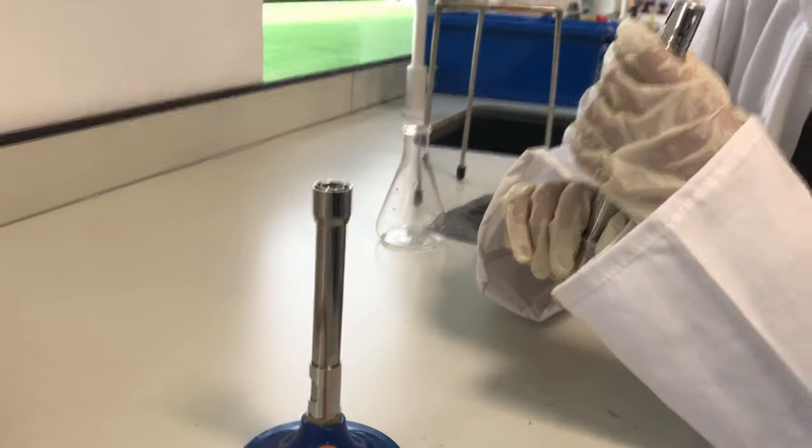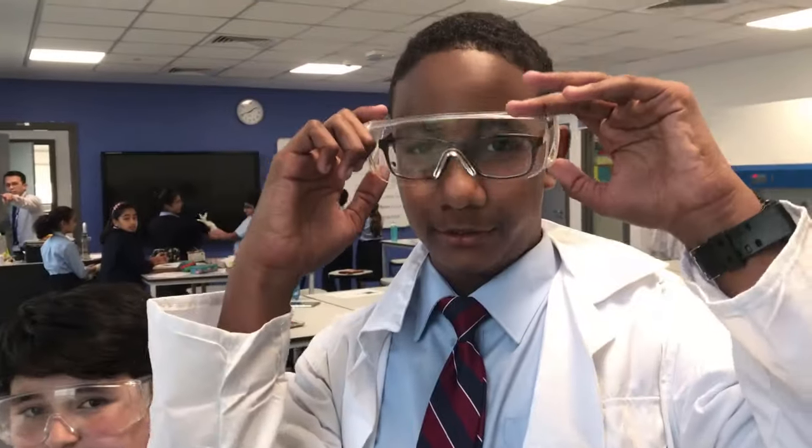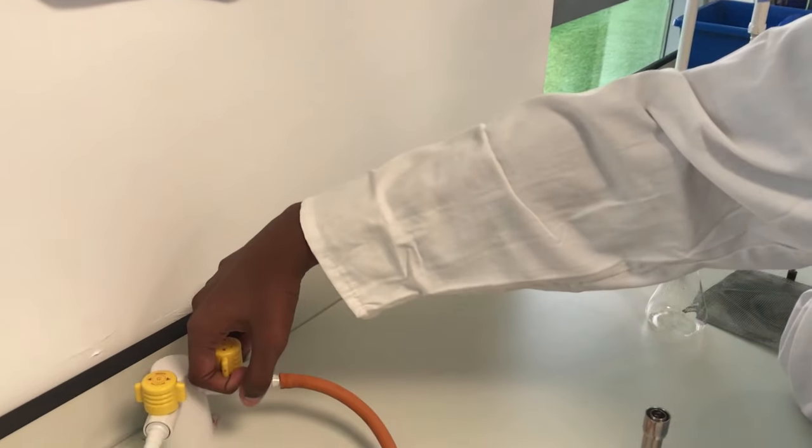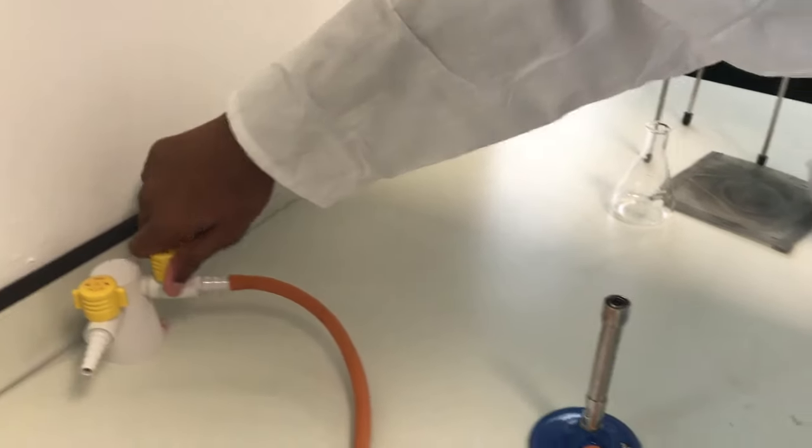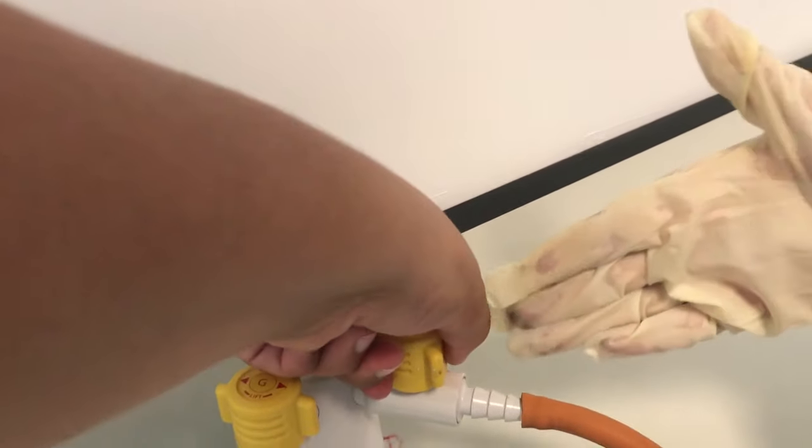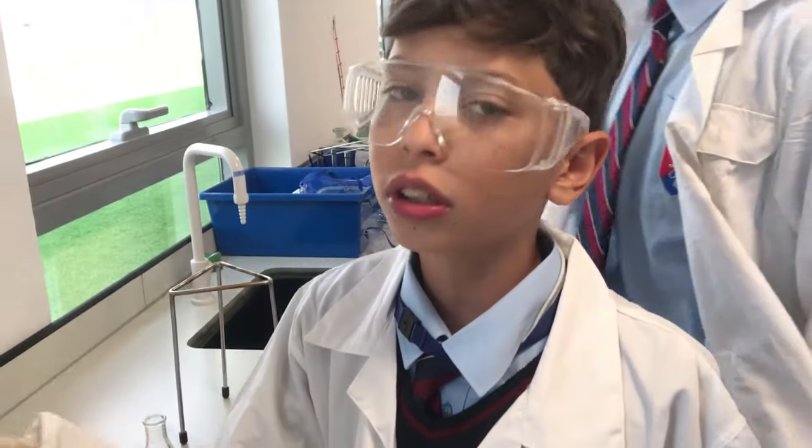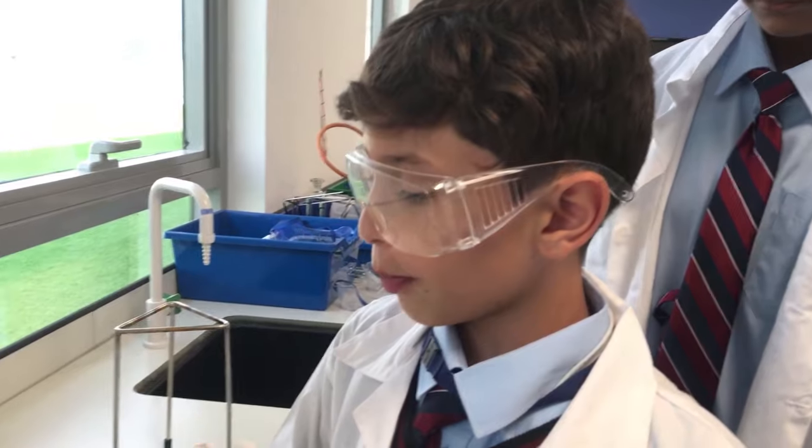This is a flint and steel too, but there you go. So basically what's supposed to happen when you use this, it's supposed to flip up and turn the gas around, which I cannot do. Okay, you're supposed to lift it up. Yeah, lift it up, lift it up. And this, as you can see, those two handles have to be straight but exactly the same as the tap. If that's not, that's going to be, well, it's not on or it could cause serious damage to the gas or gas pipes.